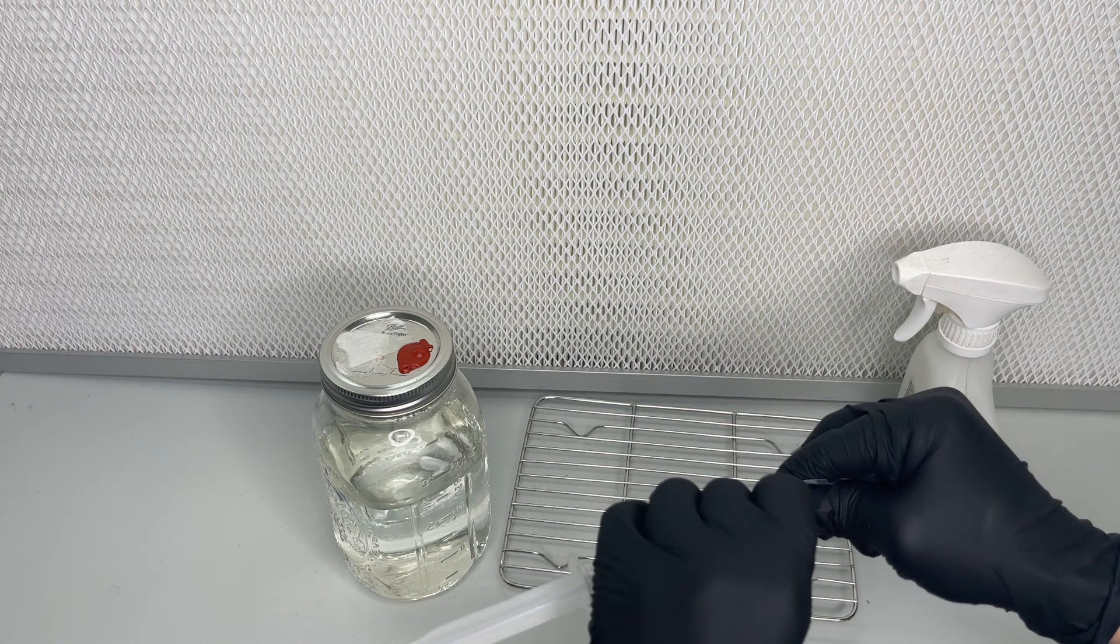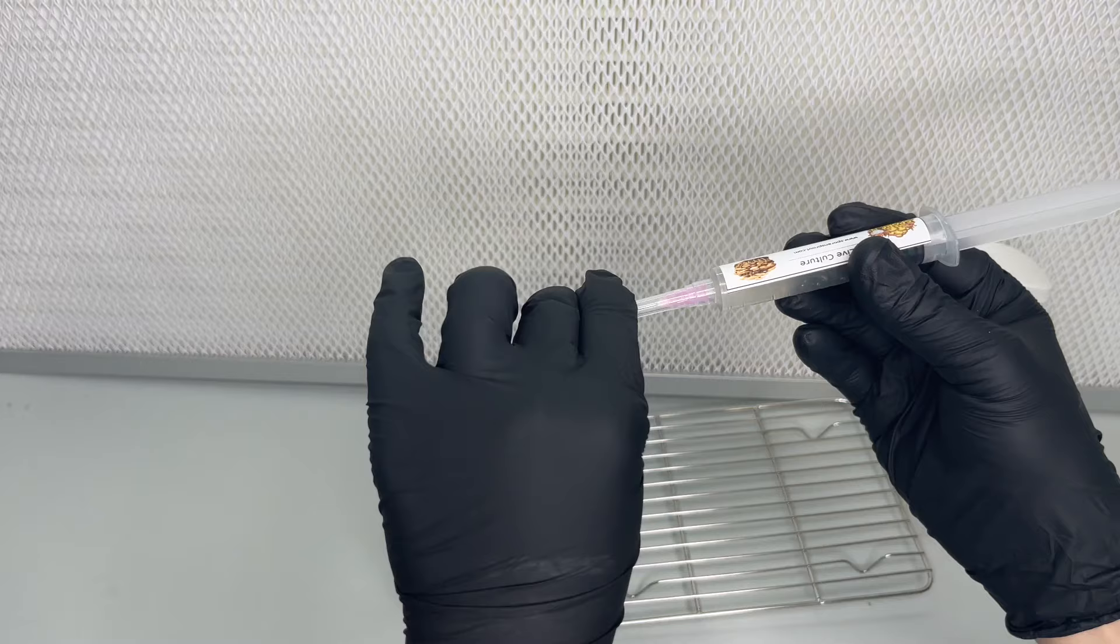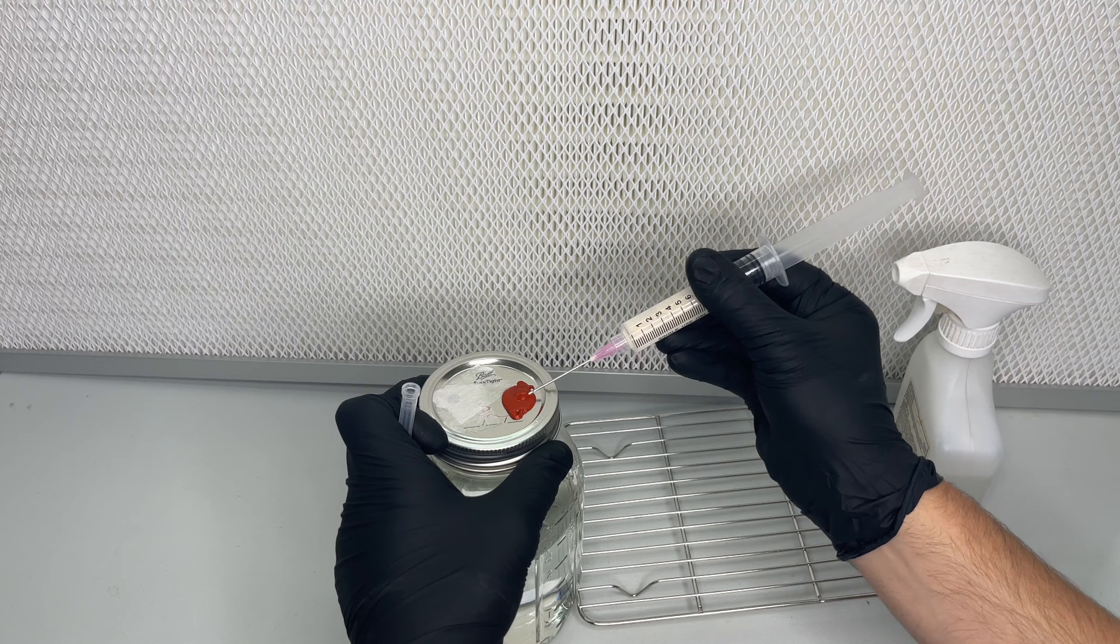If I was using a spore syringe, I would only use one milliliter, but I'm using liquid culture, so I'm going to use half of the syringe just to speed things up.